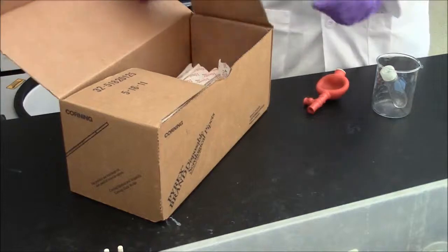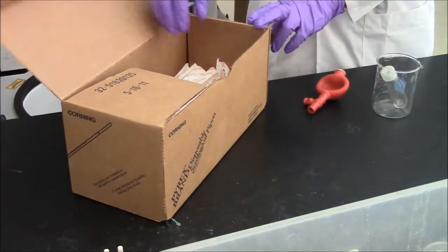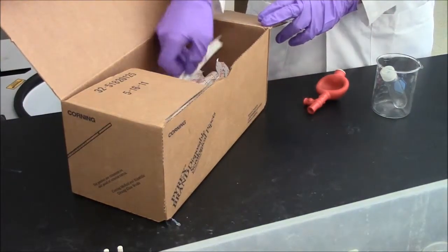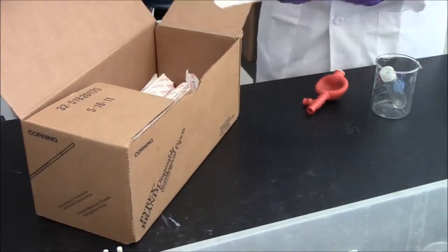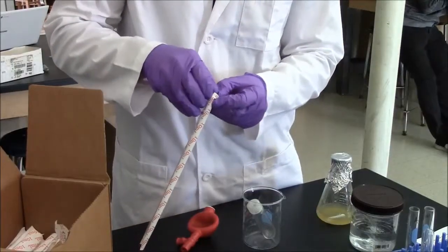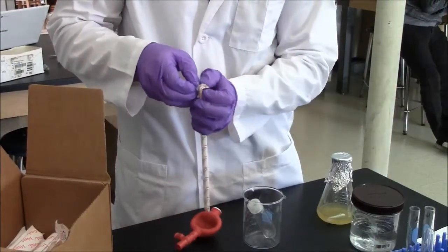You'll start with a disposable serological pipette from a box like this. These are 10 milliliter pipettes. Open the package. The pipette inside is sterile.